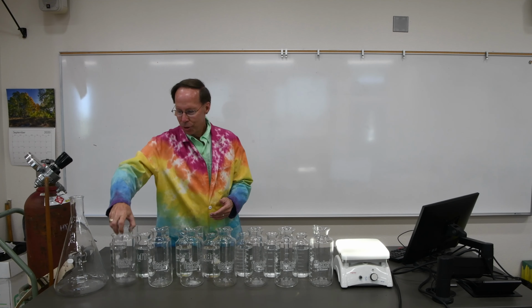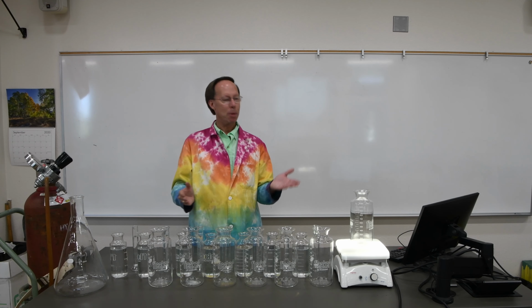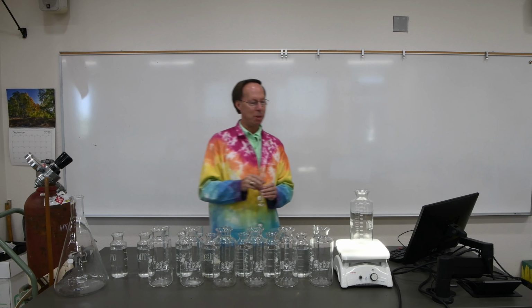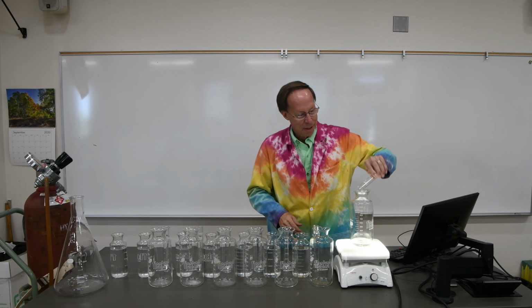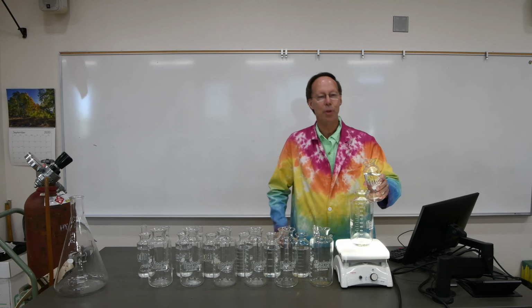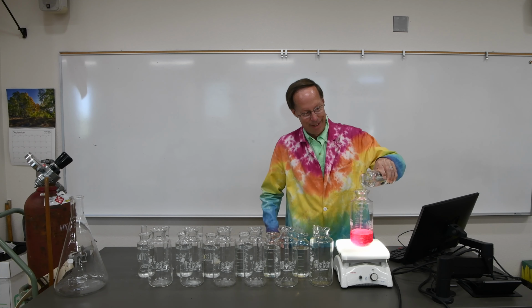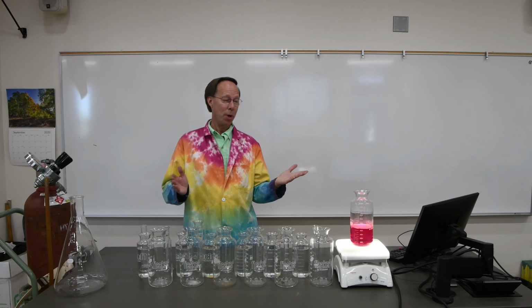So let's start out with this first beaker here. Now, by the time I've added both of my chemicals to that beaker, it's going to change a color. Why don't you see if you can guess what color it's going to become? So let's add a little bit of this first chemical here. And now we'll add the second one. See if you can guess what color you think this is going to change to. Ooh, I think it's pretty obvious. That's a lovely red color. One of the colors of the rainbow.